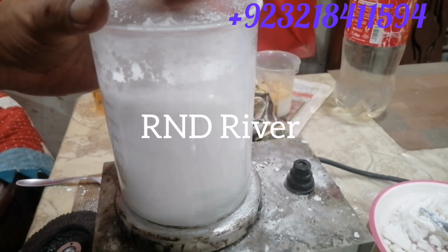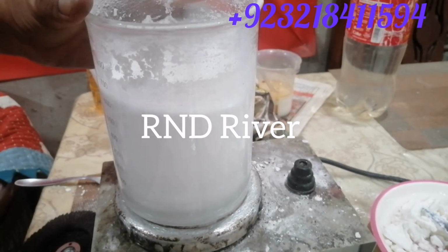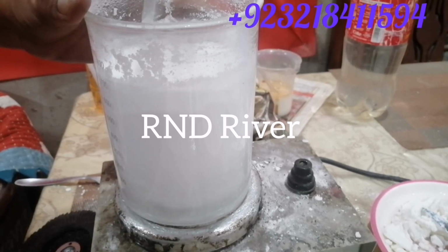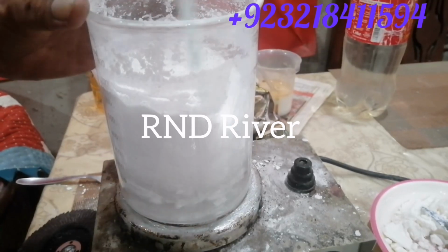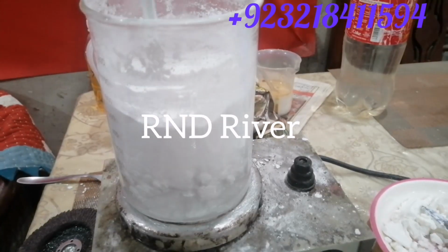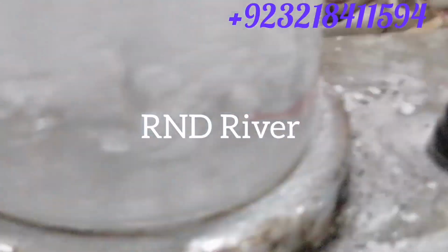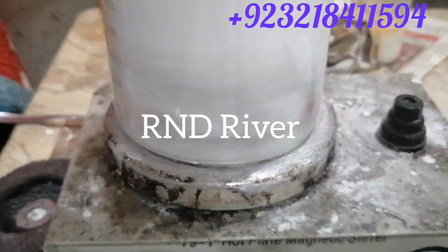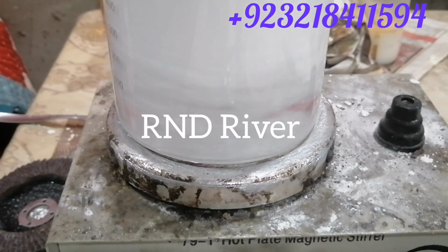Look at the bottom of the beaker. Look, it means calcium stearate, the reaction is going to finish. Now it is a very important process. Watch very carefully and listen very carefully.